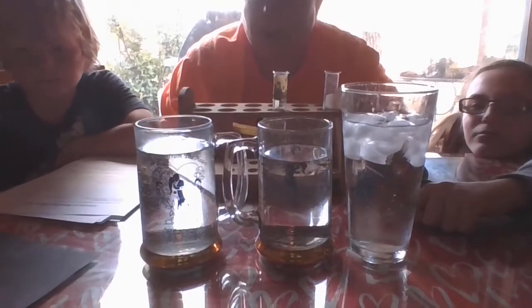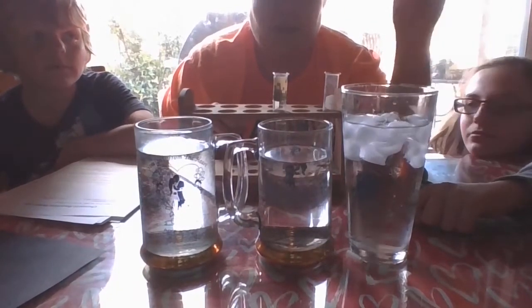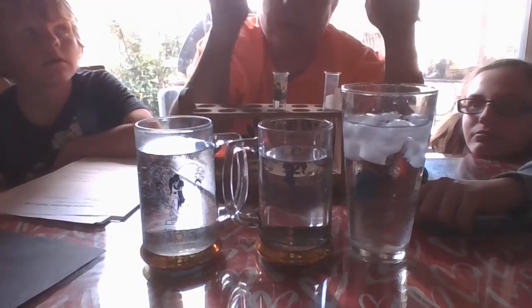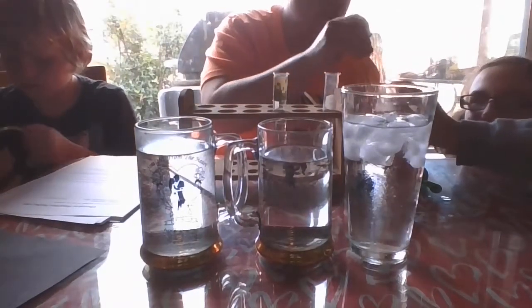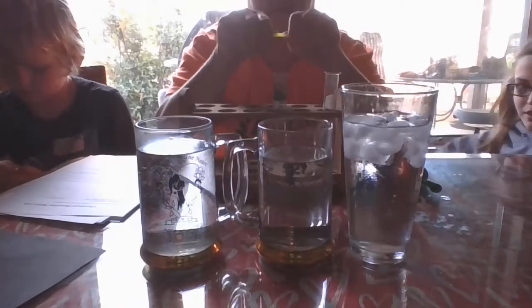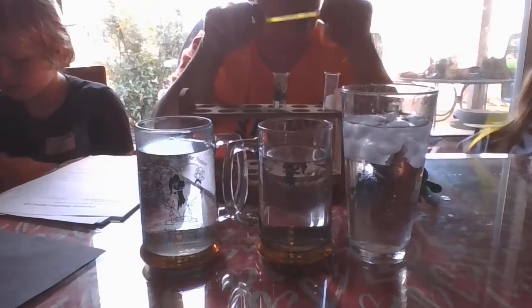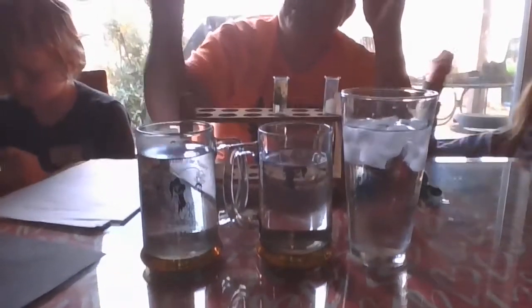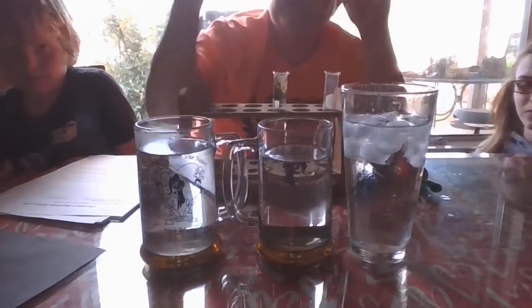What I want you guys to do right now is pause the video for a minute and start filling in what it looks like before. We're going to crack these and show them to you, and you're going to fill that out. Go ahead and crack that one, Jace. Crack that one, Josie. When we crack them, we're starting that chemical reaction. If you notice, they start glowing, and that's because there's a chemical reaction happening. So we've got that started.